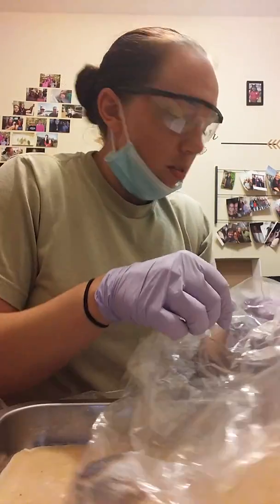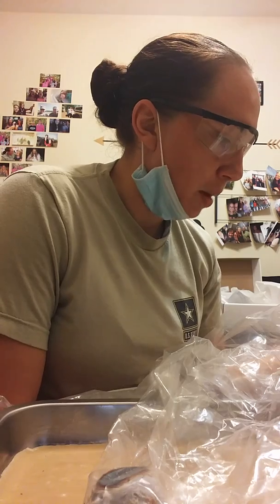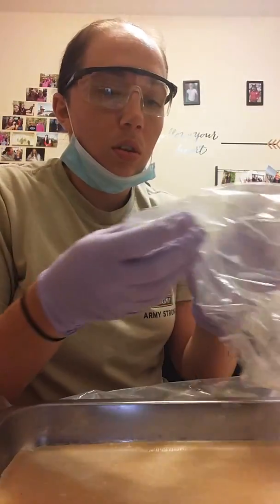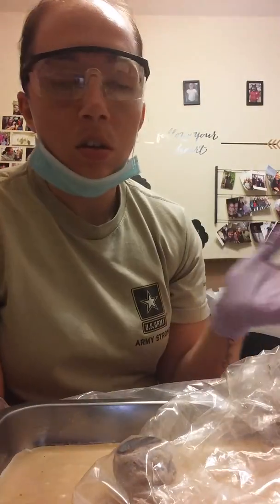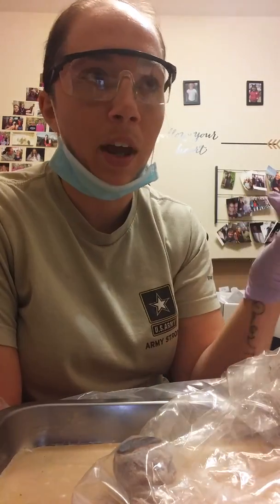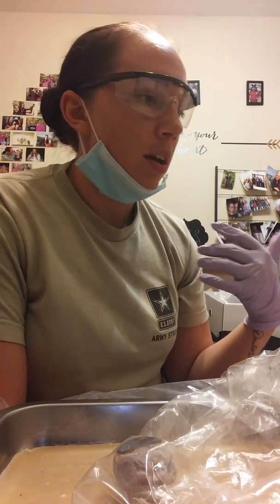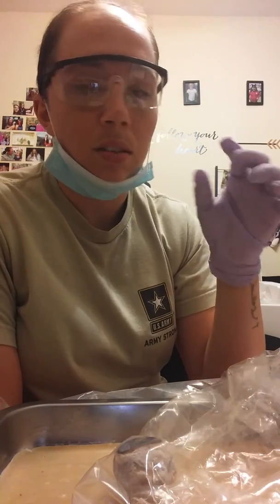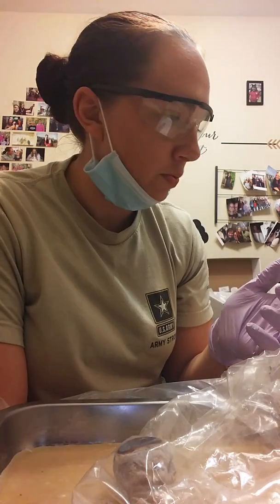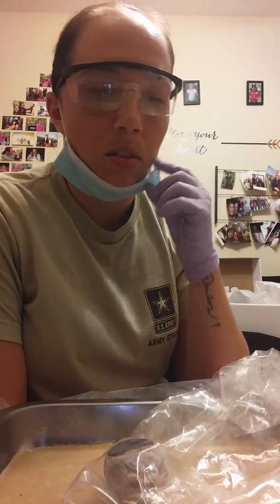Some of the questions that I have to answer first: through which structures, openings, and chambers of the eye does the light from the flashlight pass in order to reach the retina? So the light passes through the cornea into where the iris and the pupil are. The iris controls the pupil and what diameter it is. If there's more light, then the pupil is going to constrict. That way not as much light can get back into the retina. And then behind that structure is the lens that light passes through. Then it goes through the vitreous body, I think is how you say it, and from there it reaches the retina.